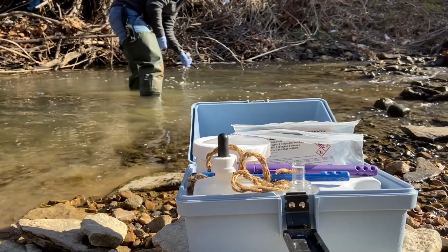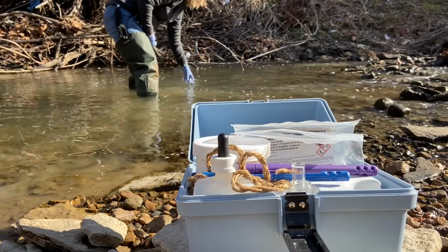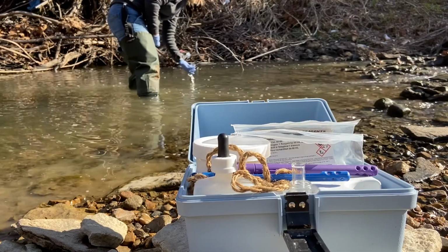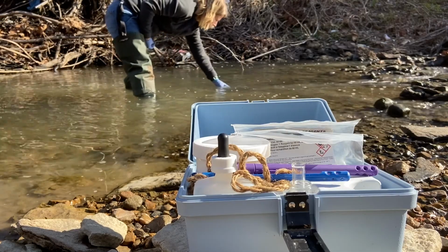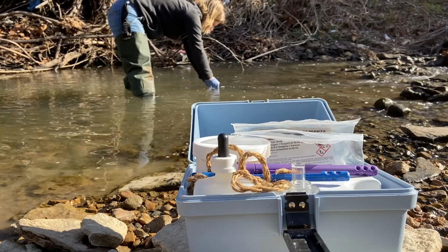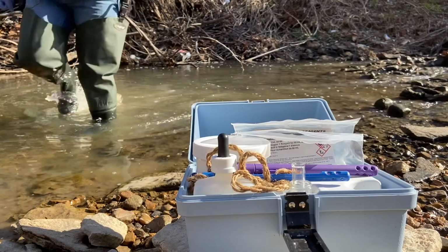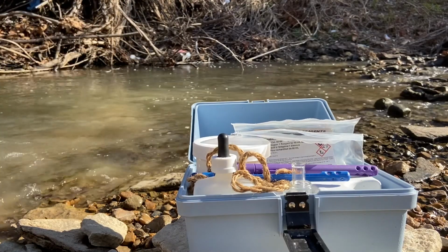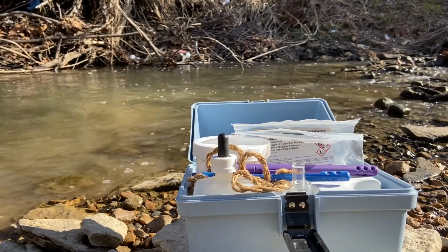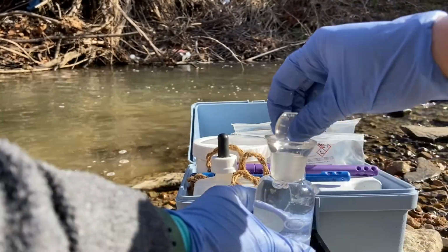When you collect your sample, you might disturb the stream bottom. Take care not to collect floating sediment in your sample bottle. It's recommended to place the stopper in the sample bottle while the bottle is still underwater. When you pull your bottle up, there will be a small amount of water pulled around the stopper. This small amount of water will reduce your chance of getting an air bubble during the next step of adding DO1 and DO2 reagents and returning the stopper.